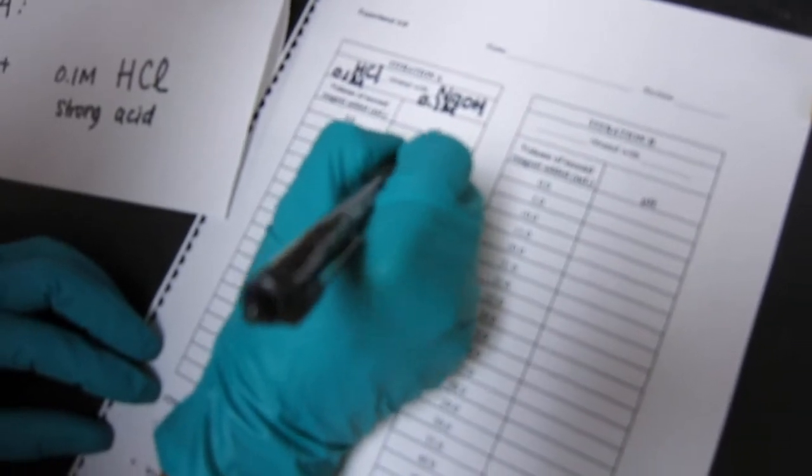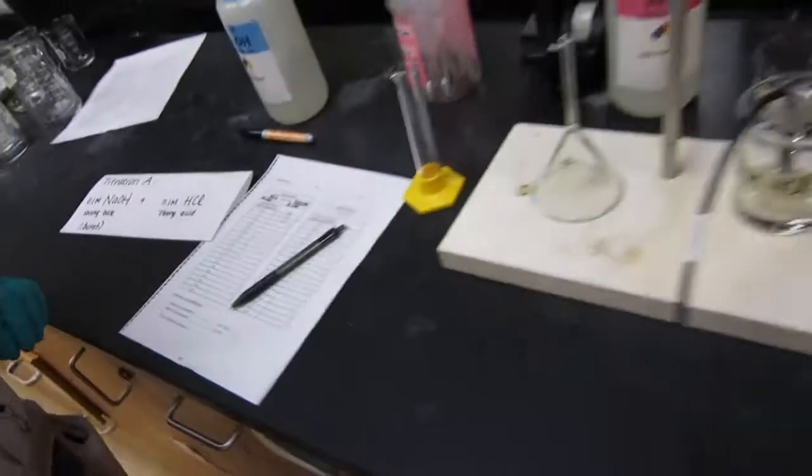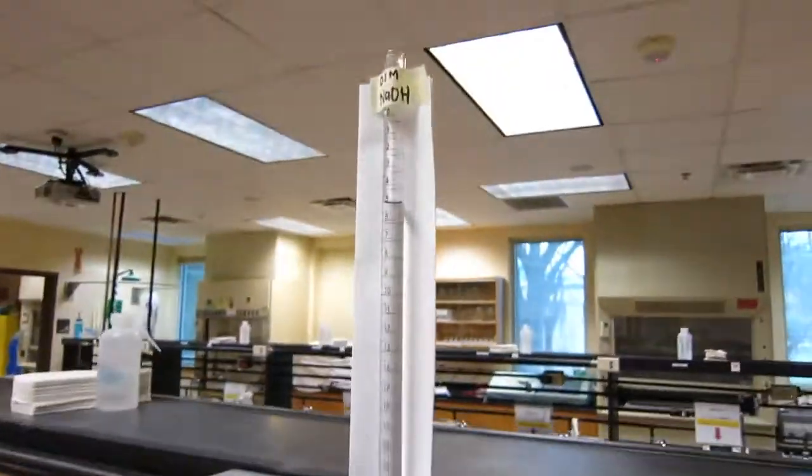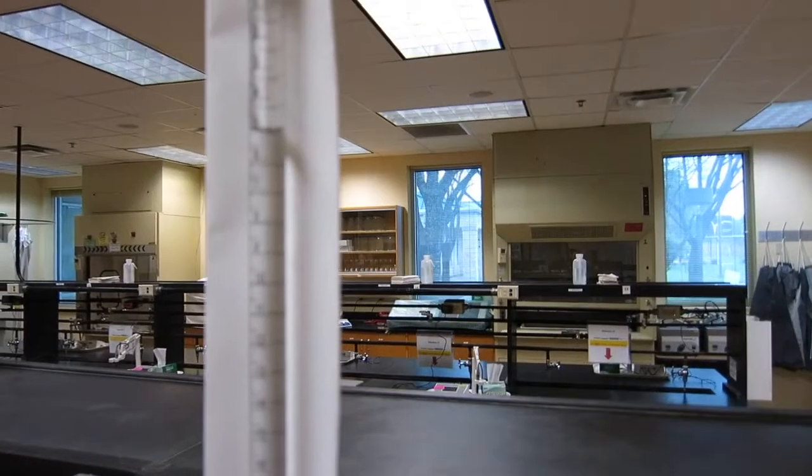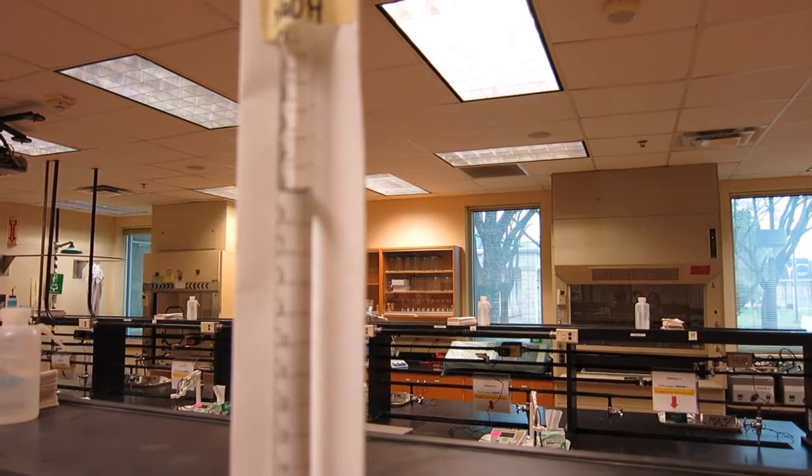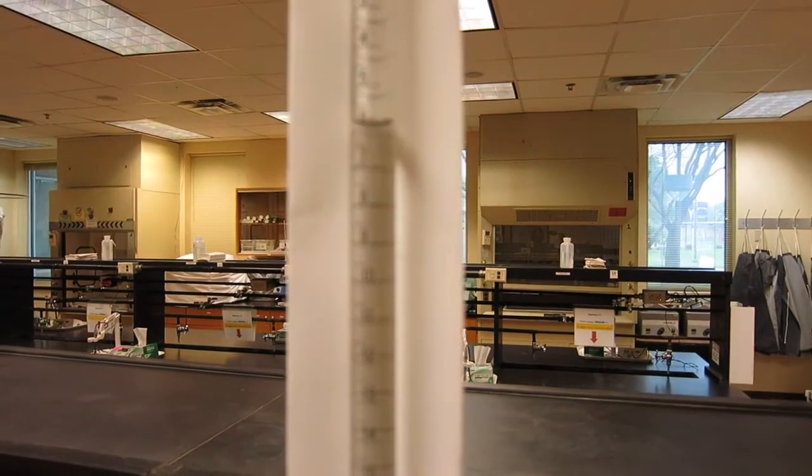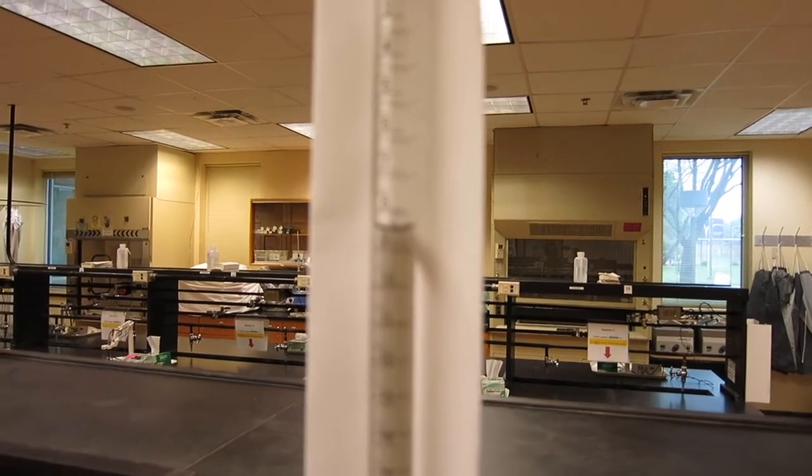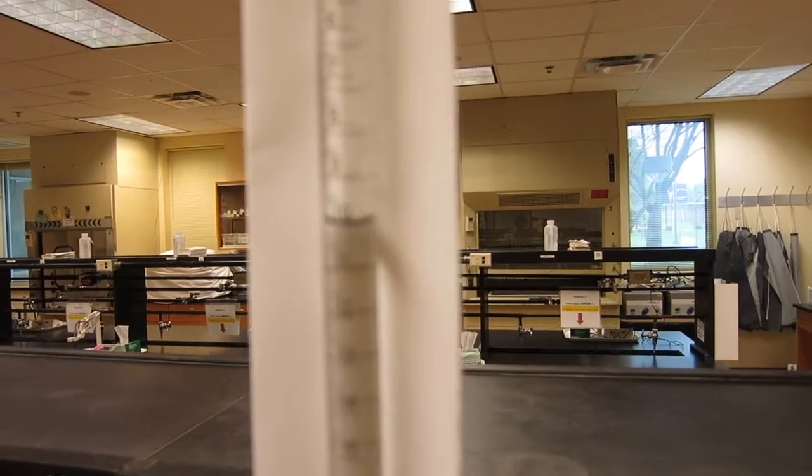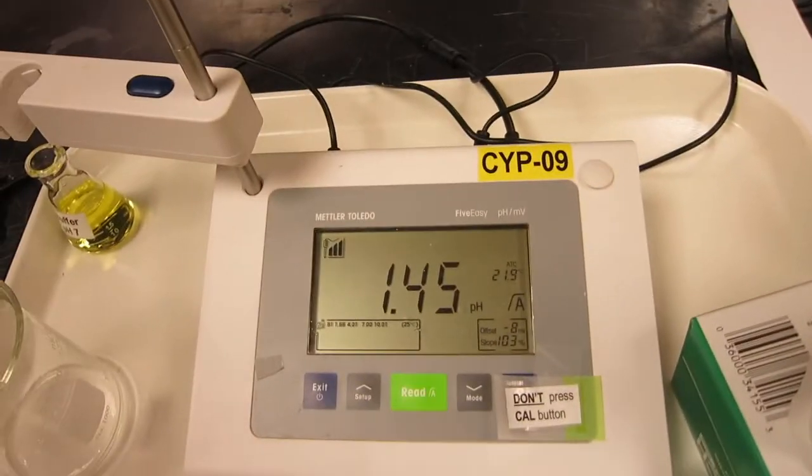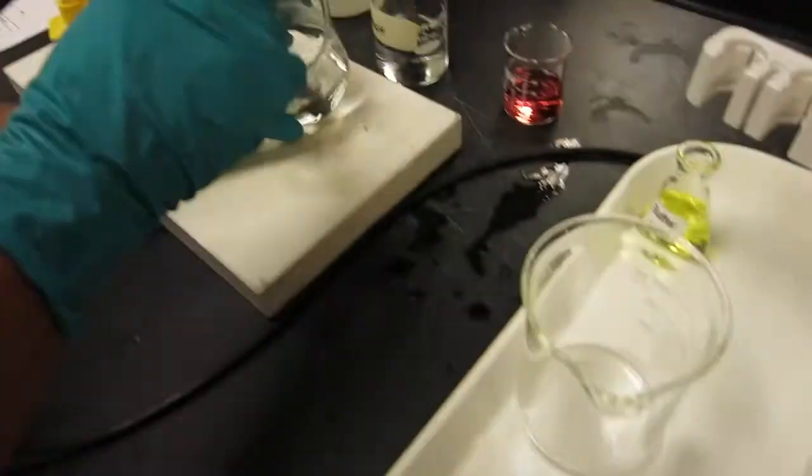We go back there and write. 1.45. Next we're going to draw another 5, up to 10. So now totally 10 mL into the beaker. I'm going to press read again while she's swirling there.